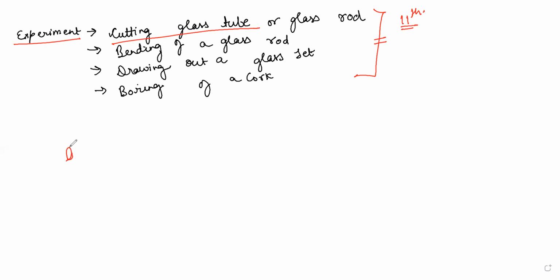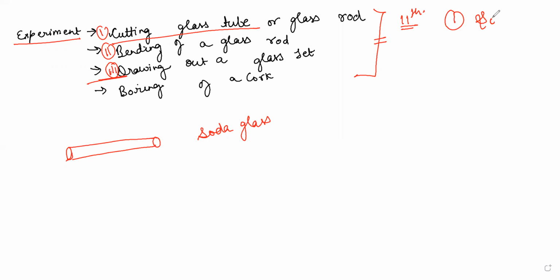Now, the tube which we use here is made of soda glass. This should be of appropriate length, because whether you will be cutting it, bending it, or drawing a jet out of it, the first requirement for all these things, experiments number 1, 2 and 3, is that you should have a glass tube of appropriate length. And the one thing you should be aware of is that we are using a soda glass tube.